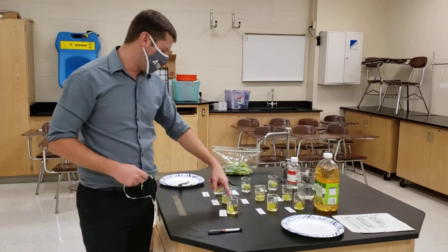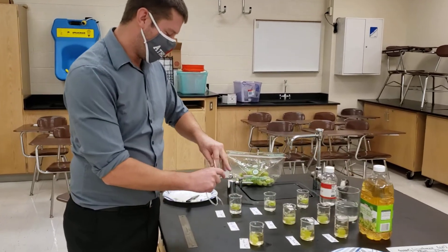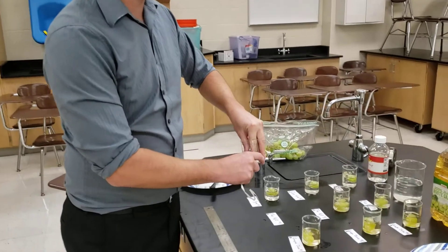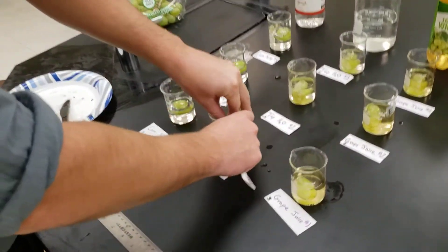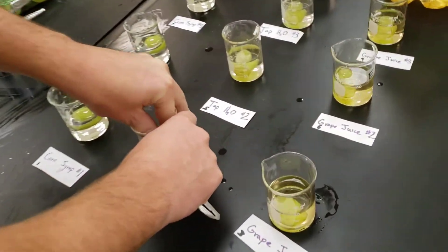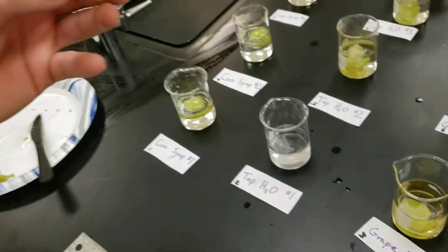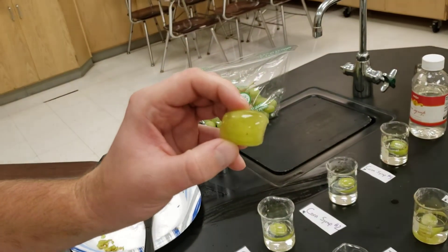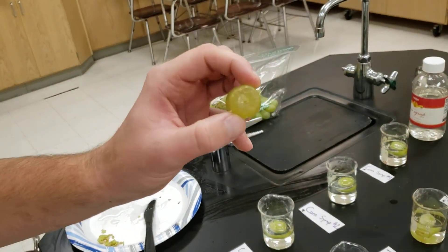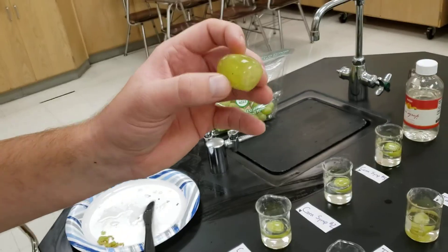So I'm going to measure this one here. This particular grape was put into tap water 24 hours ago, and we're going to see how much the size changed, if there was a size change.